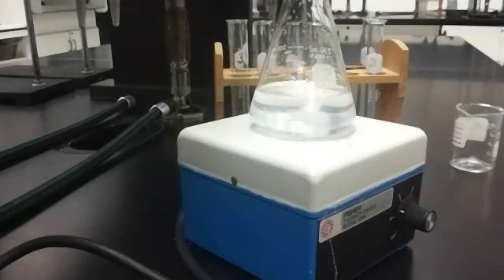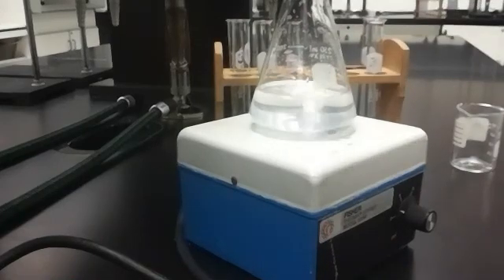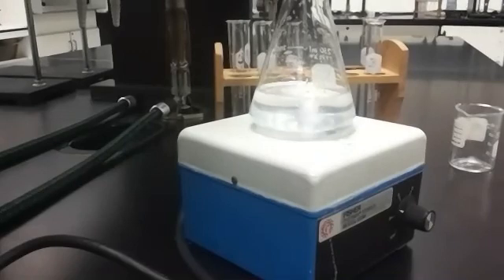When the iodine does not have a charge, when it's in a neutral form, it complexes with starch to give us a color. You've probably seen that in your biology classes before. There's a lot of labs where they use iodine as a color change to indicate for starch. I'm going to go ahead and get my other test tube ready. We would basically sit here and do this for 7 test tubes, and we're going to graph the data. In a few minutes, I'm going to show you how to graph the data.